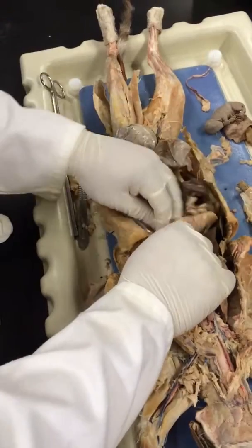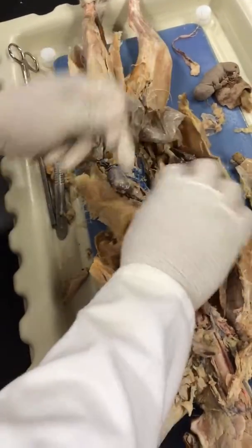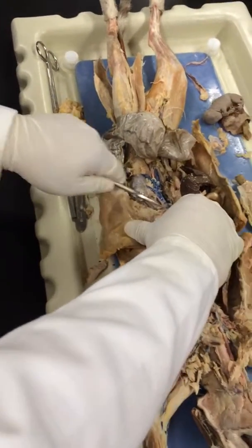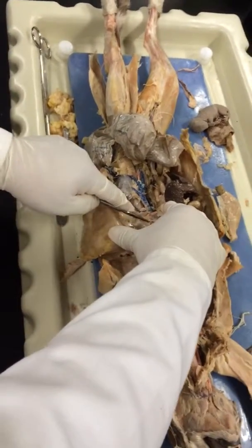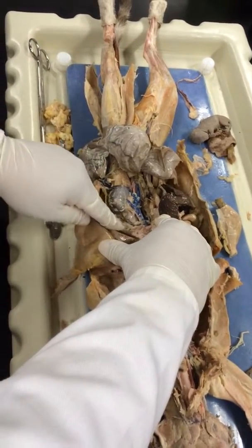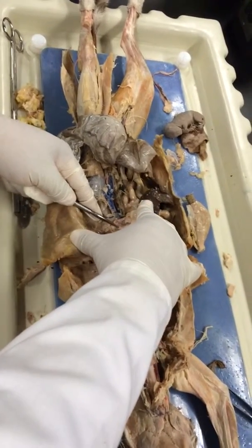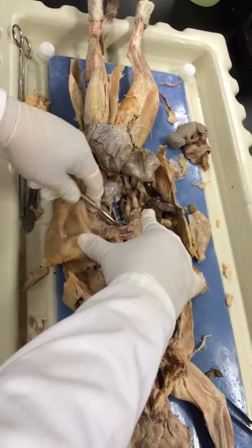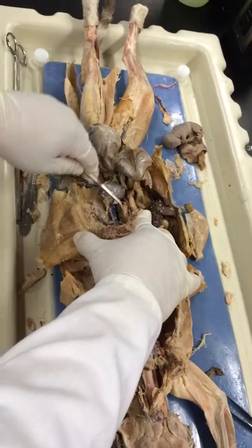And as we make our way towards the abdomen, you guys might have a little bit of trouble seeing this over there. But if you can picture, based on my description, you can probably get it. I'm going inferior to the diaphragm, making my way towards the caudal end of the cat. The first branch off of the abdominal aorta, what would that be? Celiac trunk, right? And the second branch after that one, what would that be? Superior mesenteric, right?